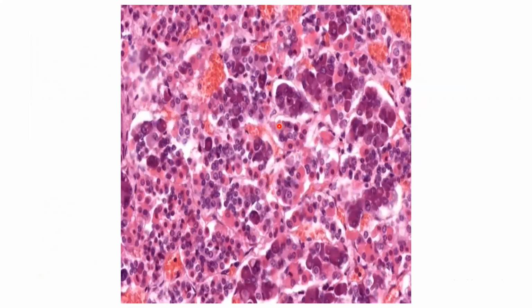How can we recognize it? We are seeing acidophilic and basophilic cells here. You see these light pink color cells. Can you see? These are the light pink color cells. And a few we are seeing in very dark violet color. They are fully occupied by the violet color cells. These dark violet cells are the basophilic cells and these light color cells are the acidophilic cells.